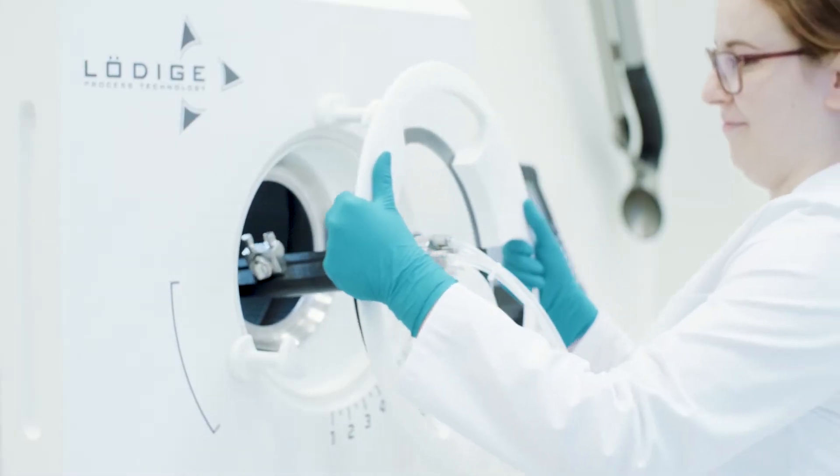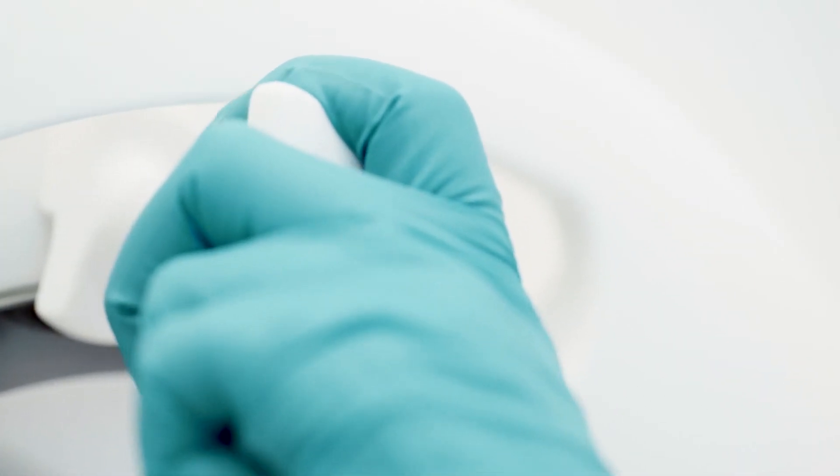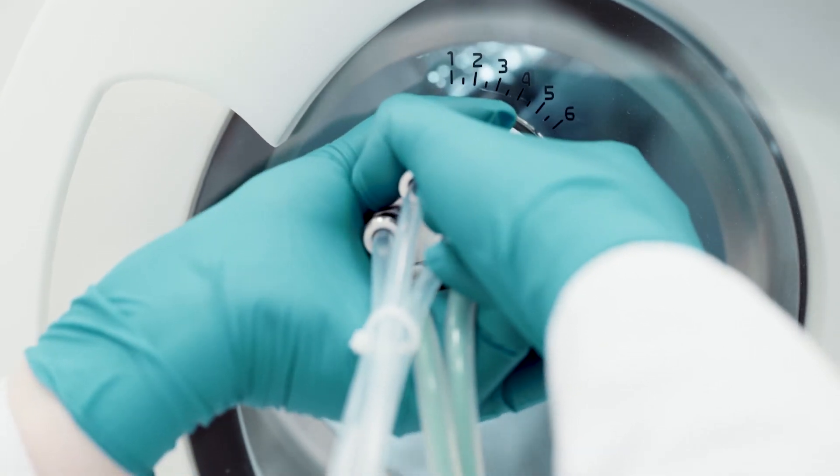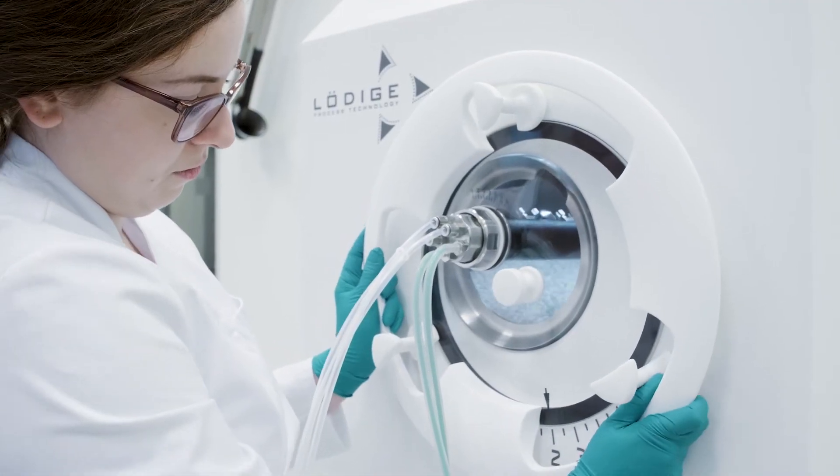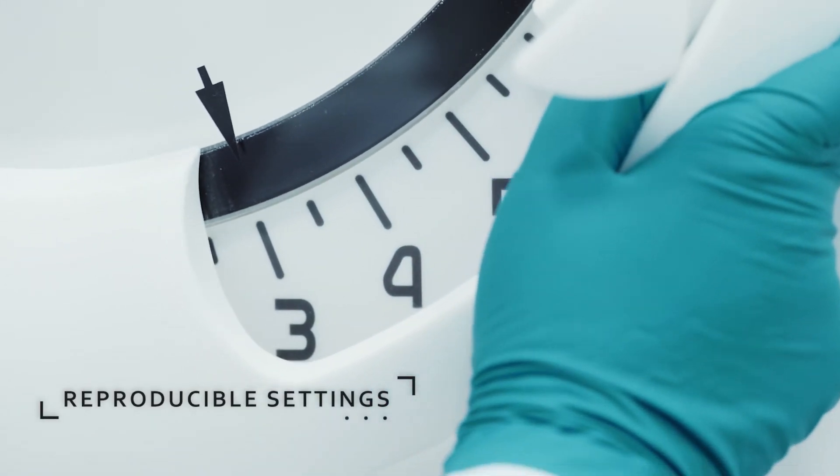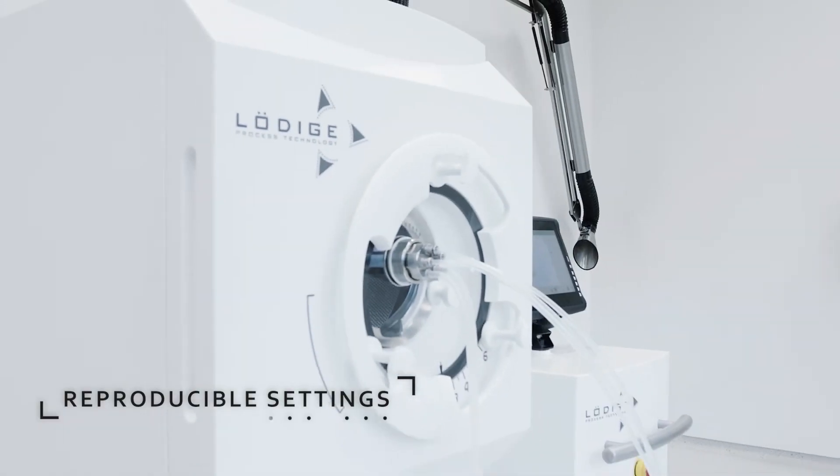The nozzle arm is inserted, locked in place, and adjusted as required. The marks used to document the position and angle of the nozzle arm ensure a precise and therefore reproducible setting.